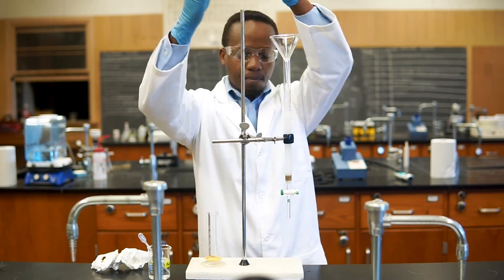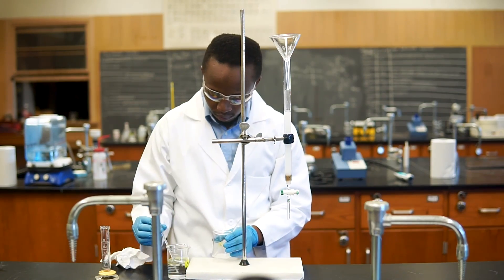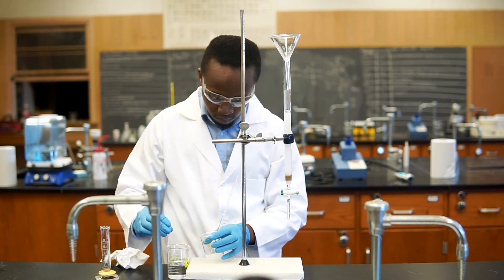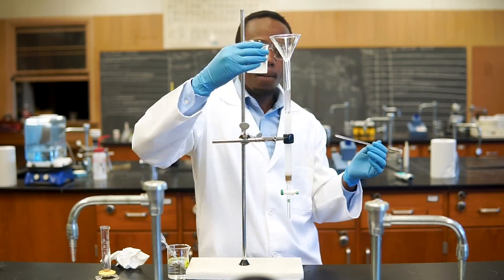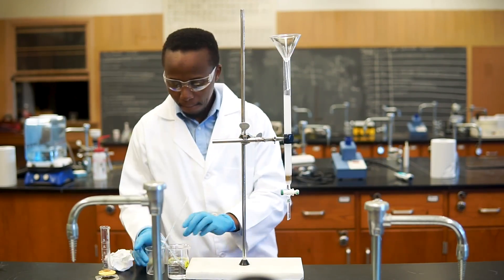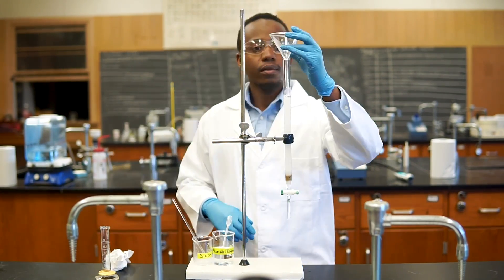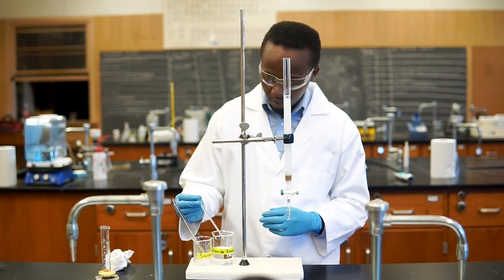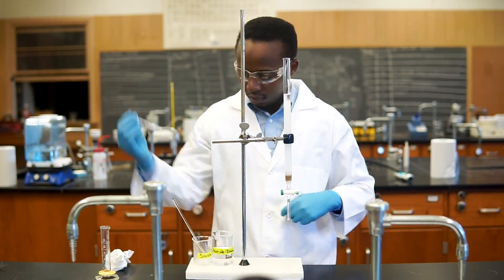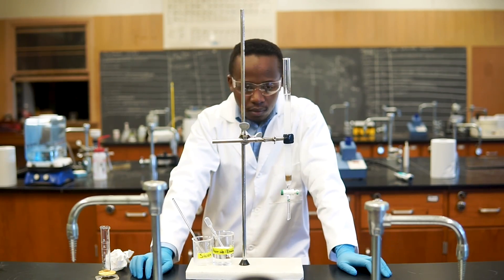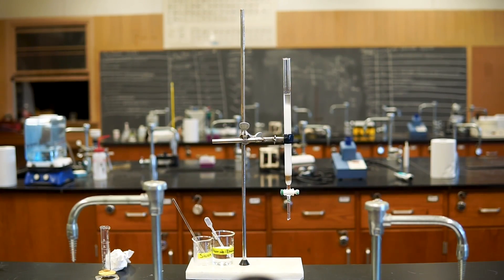Use more solvent to remove the rest of the silica from the beaker, and also to wash any gel off the sides of the column. For reference, this is called wet loading. An alternative is dry loading, which consists of adding the dry powder to the column, and then the solvent after. This technique can cause a lot of bubbles that interfere with the separation, and tends to be less effective, so wet loading is suggested.